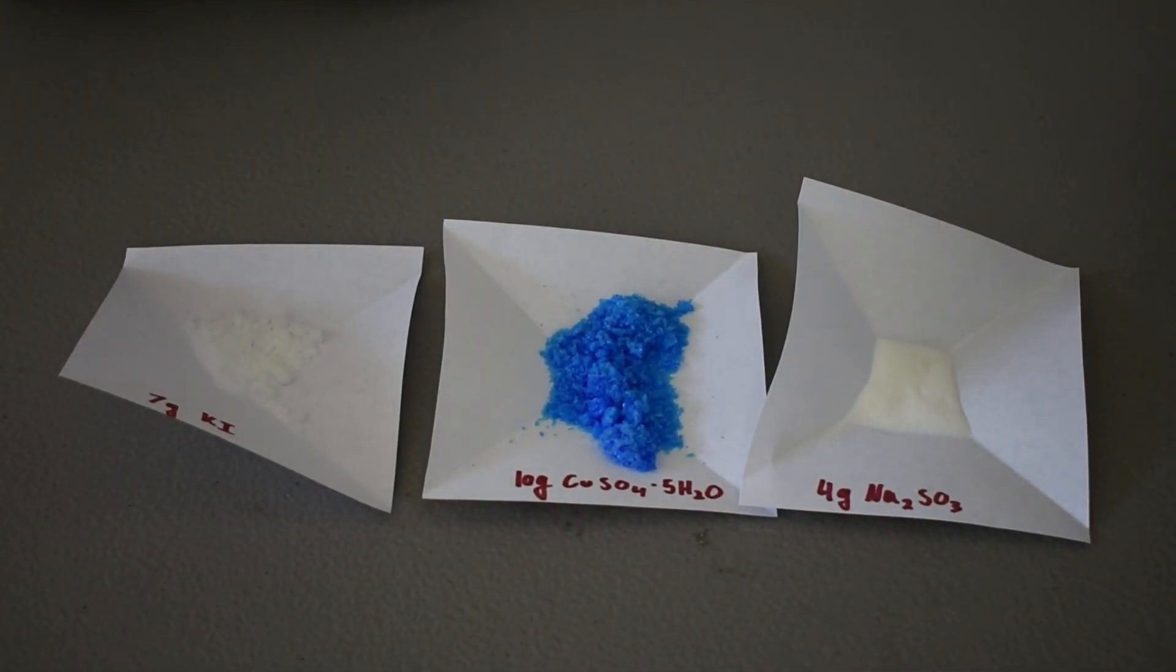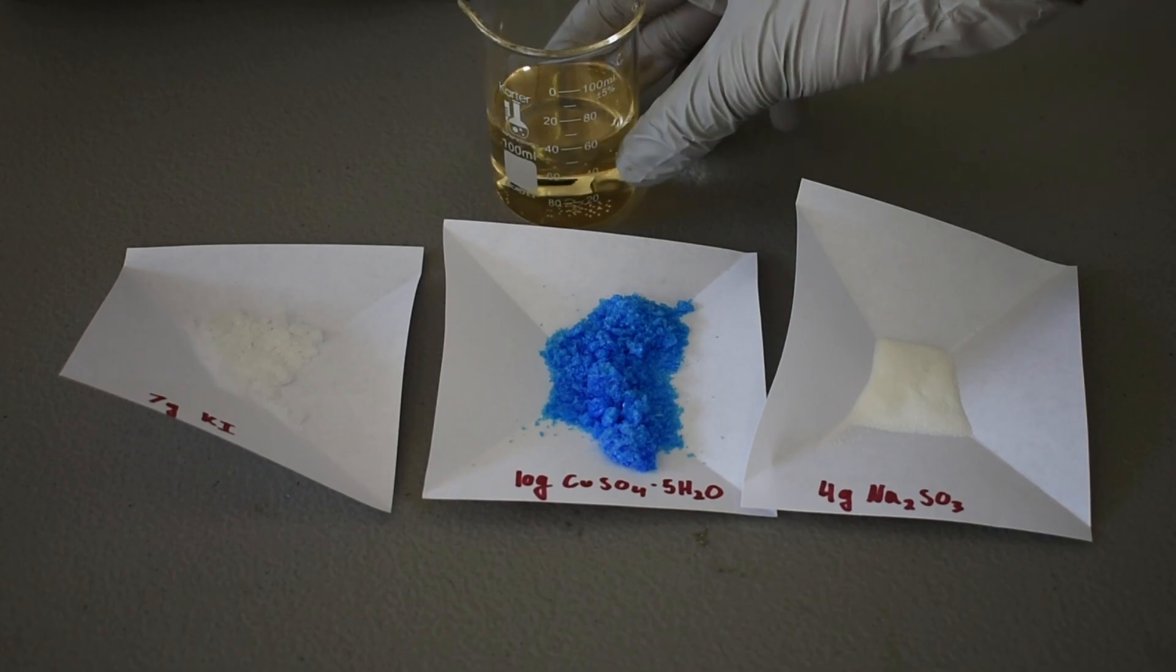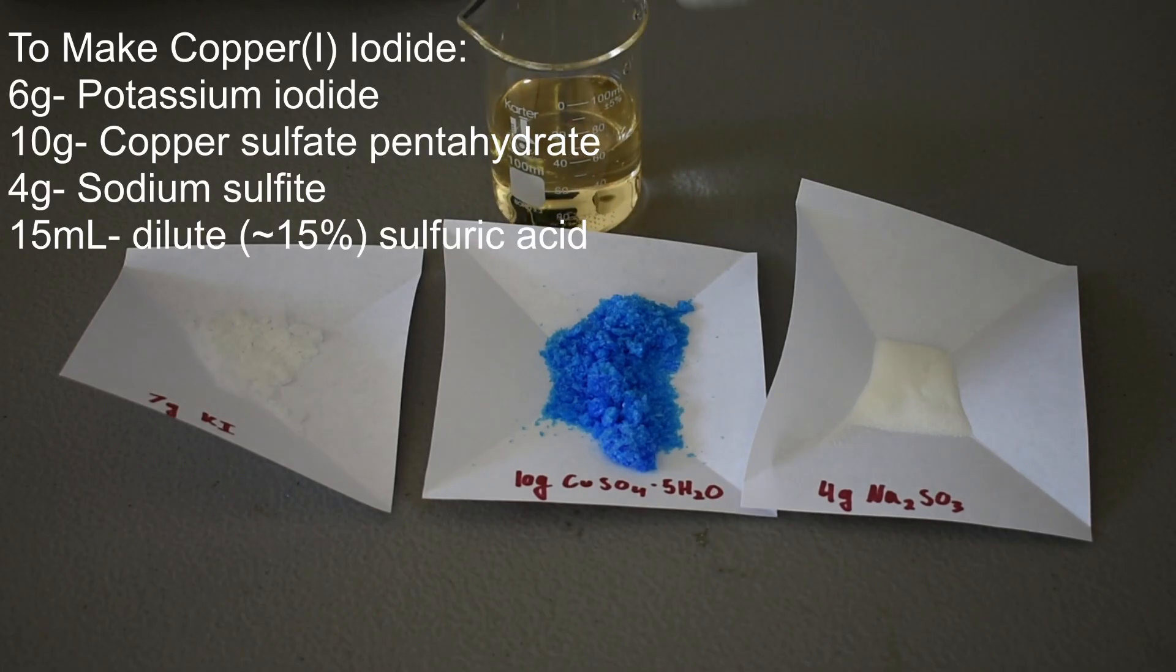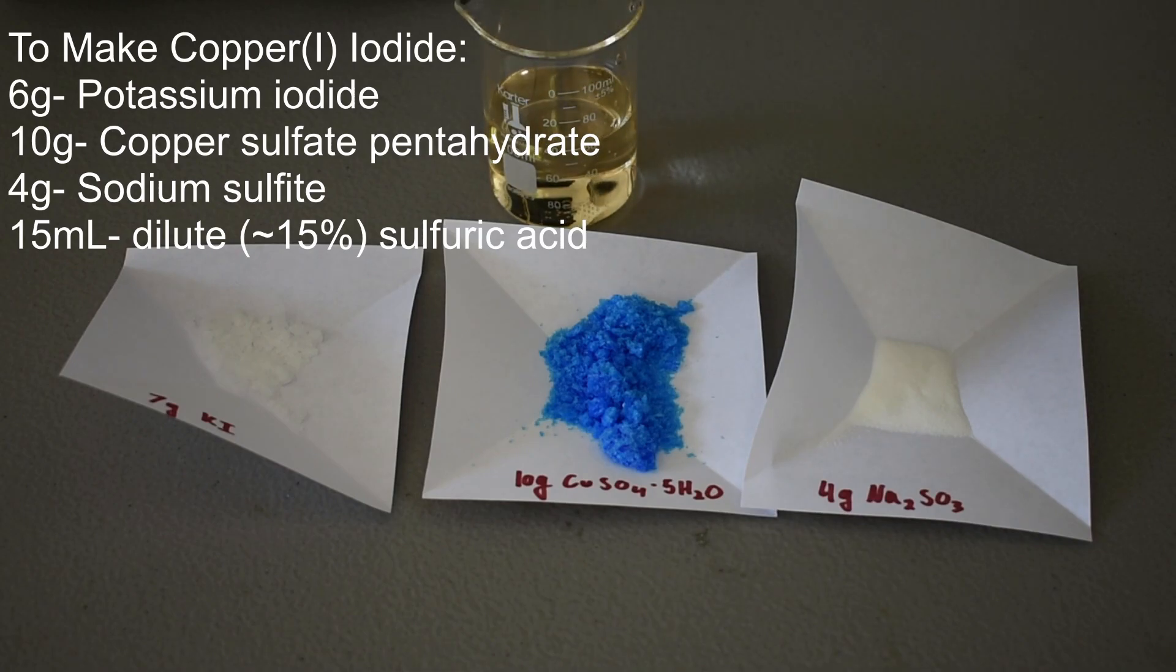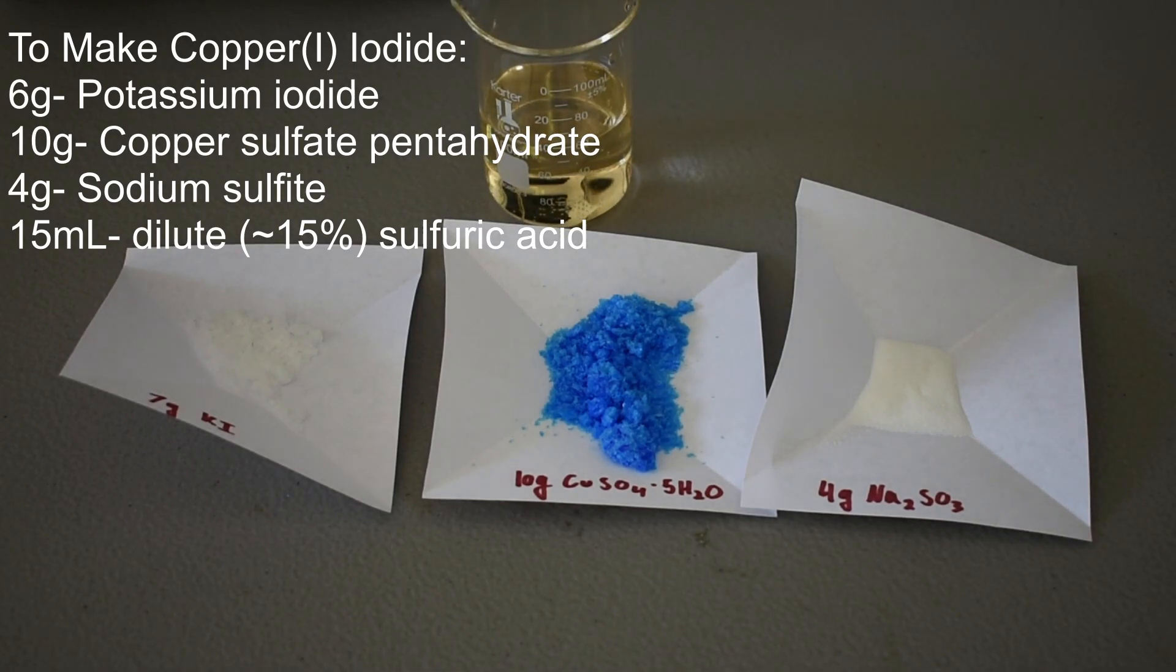And as well, some dilute sulfuric acid, which I prepared by just adding a little bit to about 40 milliliters of water. And that should be good enough. It doesn't have to be exact.